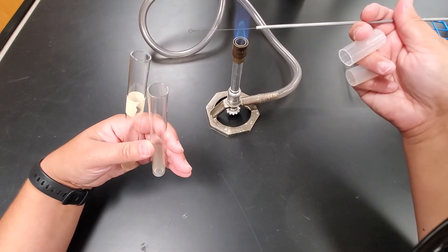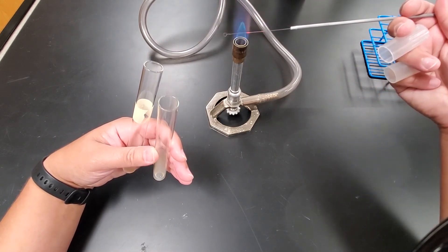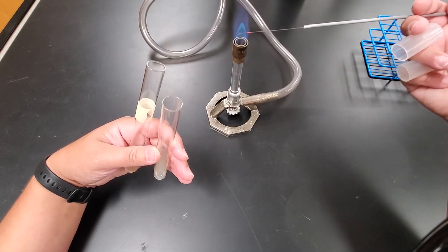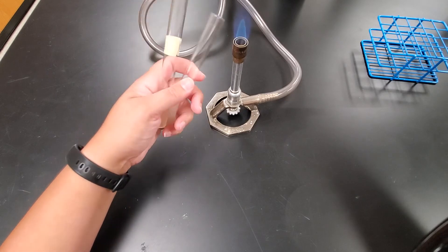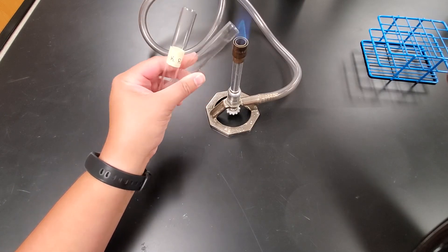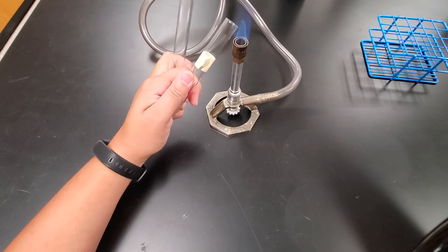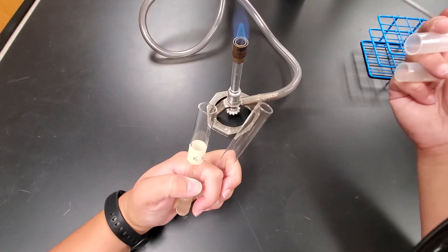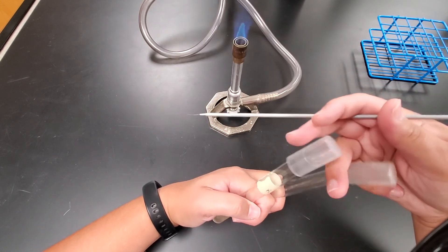Flaming of the loop, remember, is just to sterilize it, prevent contamination when you're doing your transfer. I'm going to re-flame the necks of each tube. And I'm going to wait for that to cool just a little bit. But once it's cool, I'm going to recap those tubes, both of them. Now I'm done.